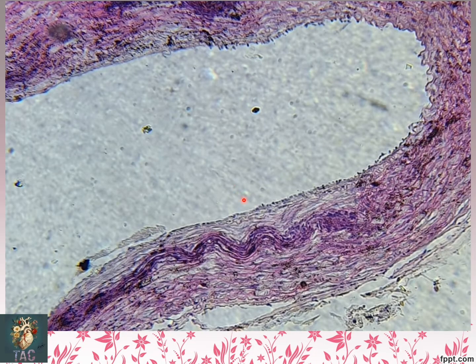Another slide, this is basically a slide of an artery, and in this you are looking at the tunica intima. You can notice here that this tunica intima is lined by the simple squamous epithelium, which is here given the name of the endothelium. So look at the nuclei. These are squamous shaped nuclei which are lining the endothelium of this artery. So this is again another slide for the simple squamous epithelium.